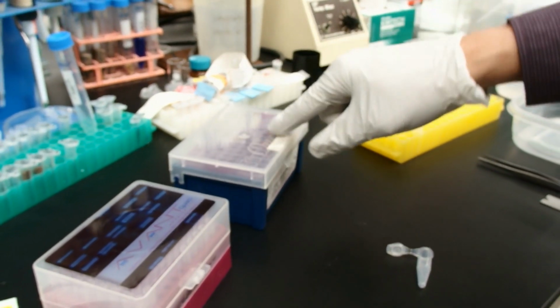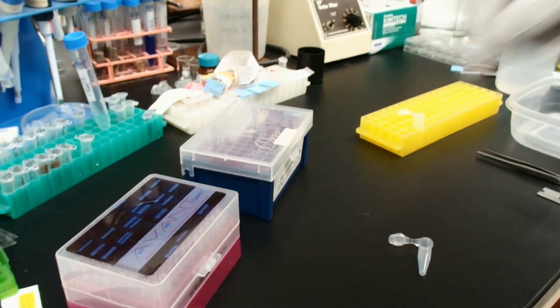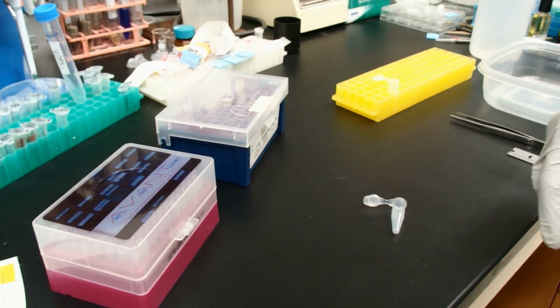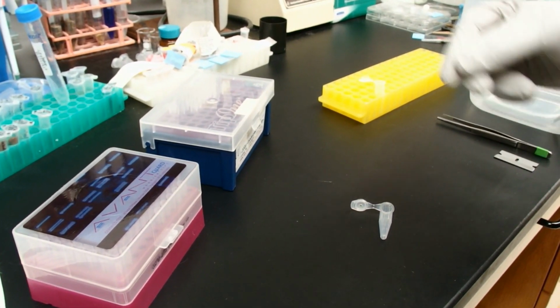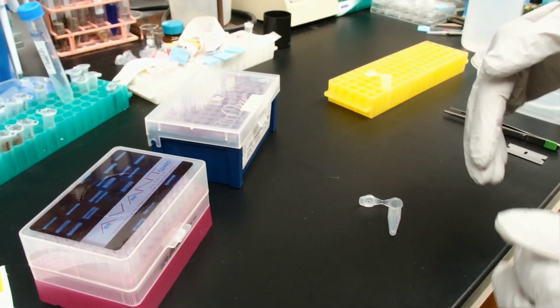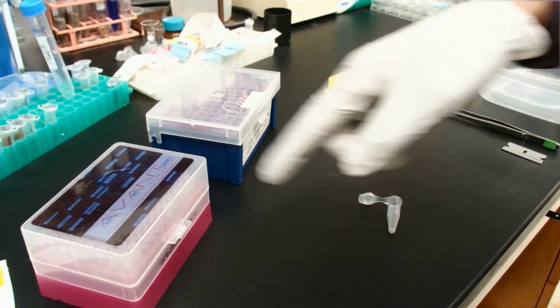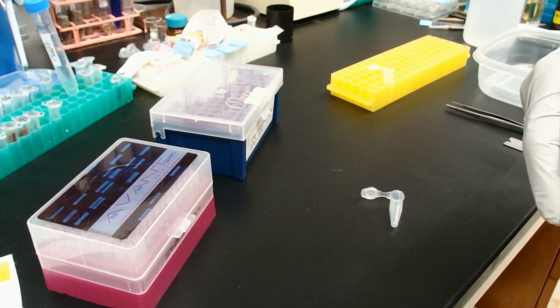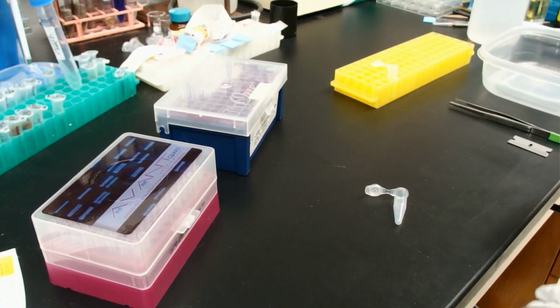The 200 microliter pipette tip will give us a bigger reservoir, so if we have a bigger piece of gel, we'll be able to put that piece of gel in there. If we have a very, very precisely cut band out of a gel, it can be desirable to use the smaller tip because we'll get a little bit better volume yield out of using that smaller tip.